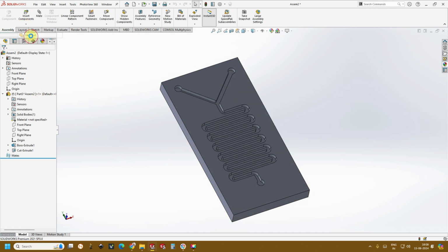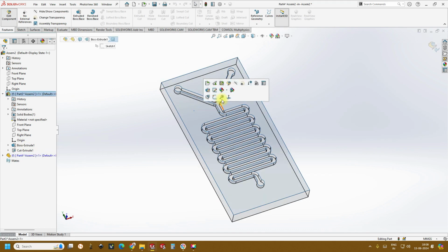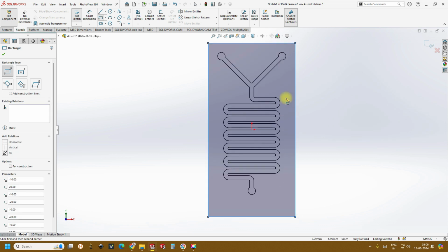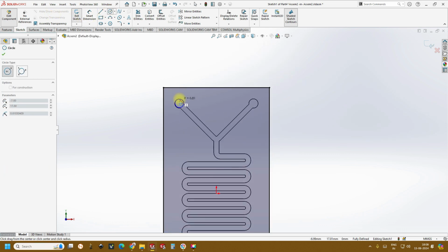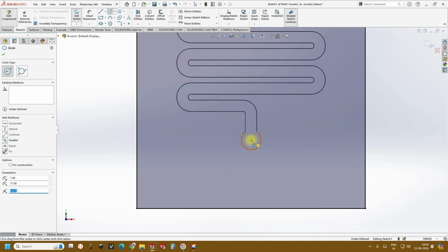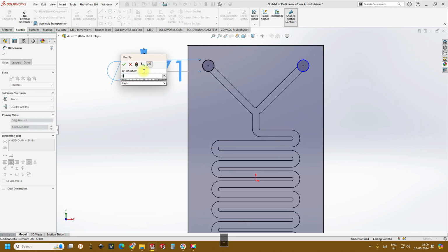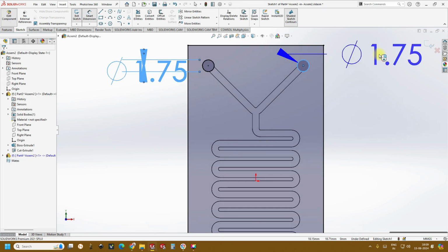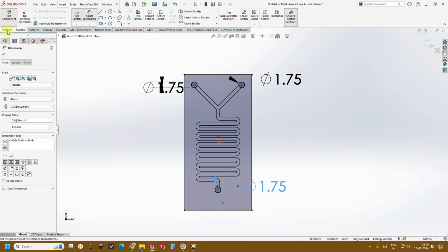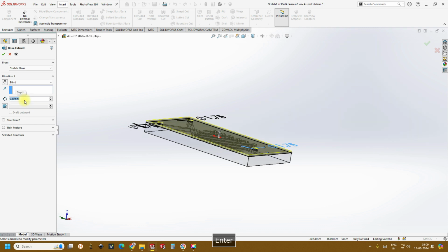for 3D printing, create another part just to enclose it. Sketch, edit, and on this face create another corner rectangle. And now let's create the inlets. And now let's give the dimensions to this as 1.75. Same here and same here. Okay, go back to features, extrude, and this is just for closing, so we don't want to waste the resin. 0.5 mm is sufficient.